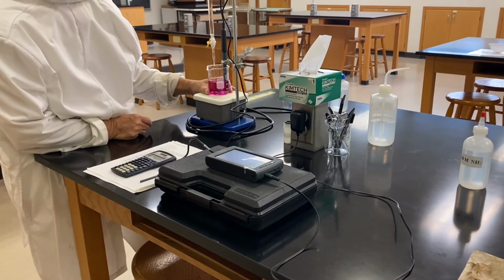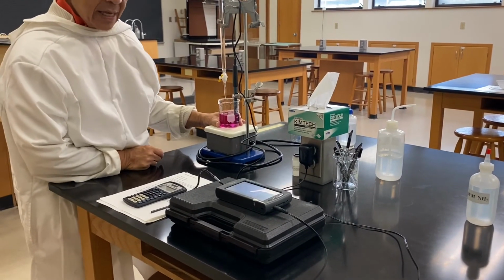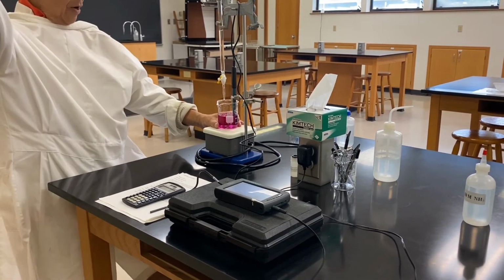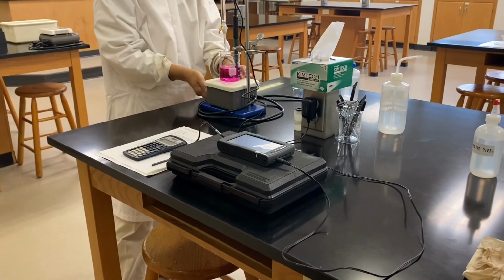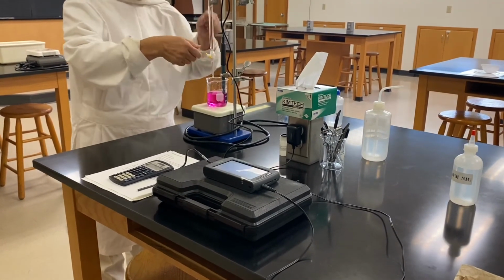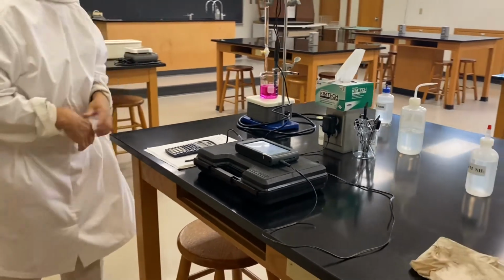And 4 and 7 and 0. Now we're done, right? So now we will turn it off and close our valve and we finish.